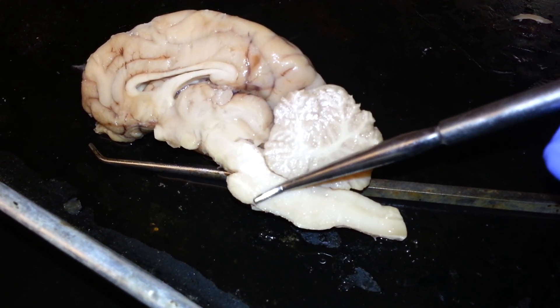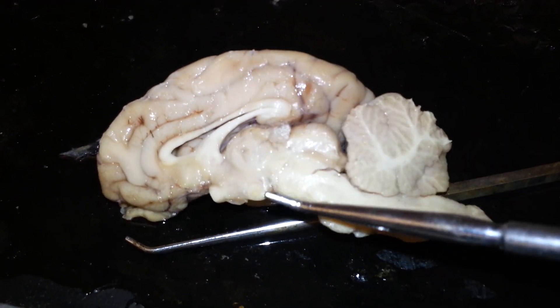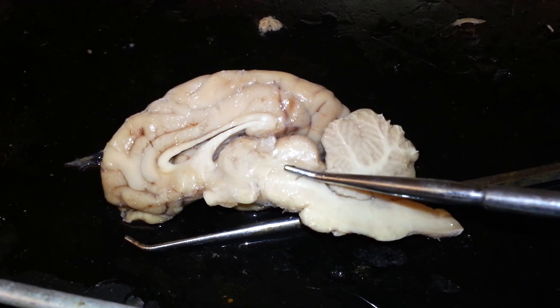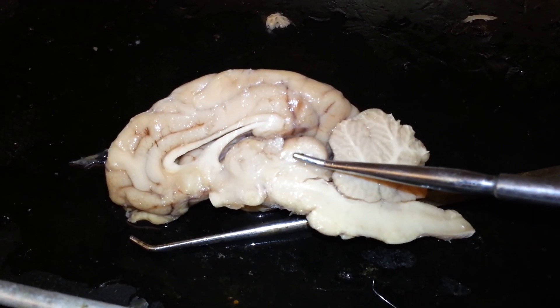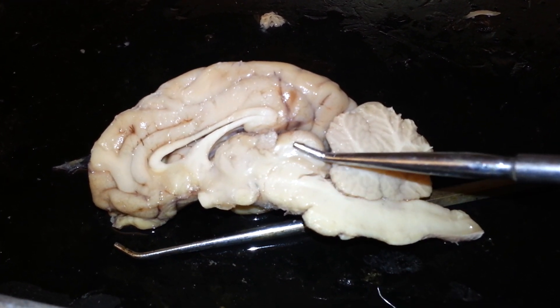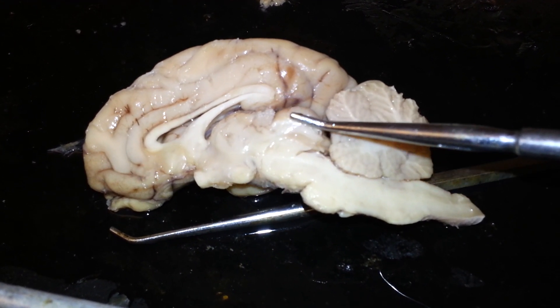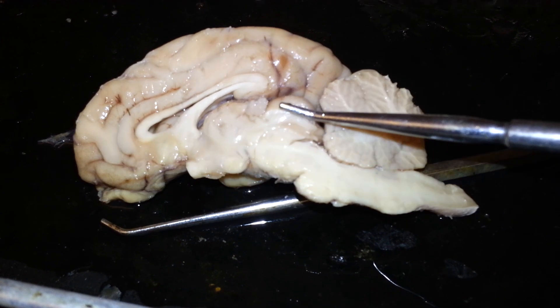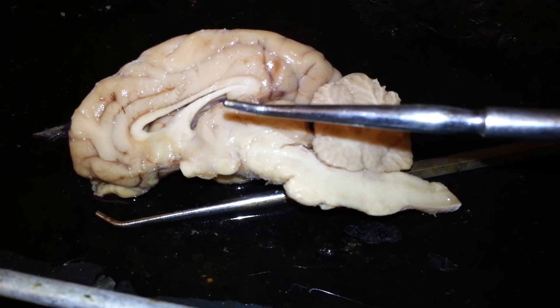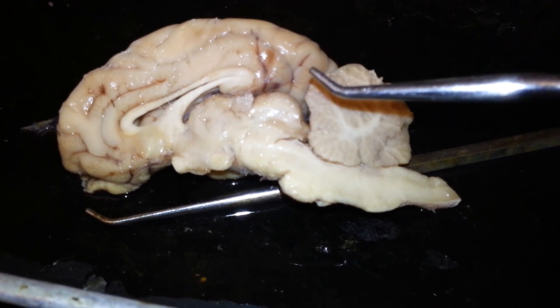Over here you can see the cerebral peduncle. Superior to the cerebral peduncle, we have the two colliculi of the corpora quadrigemina — here we have the inferior colliculus and the superior colliculus. If you were to put both halves of the brain together, you would have two superior and two inferior, making it quadrigemina.